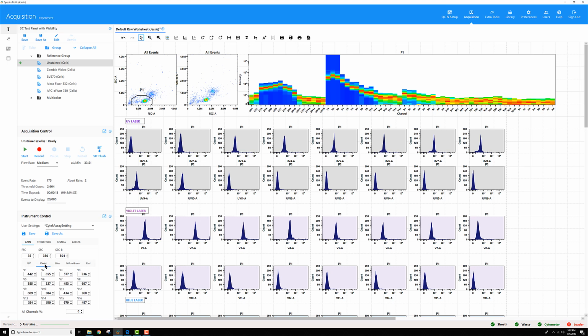So for this one, let's go to our violet dye, and I've got a couple of different options here. If I want, I can use the all channels percent gain changer, and I can bring down all of the gains proportionally across all of the channels to get everything on scale. Or, since this dye is only saturating the first 5 or so detectors, I could scale down just V1 through V5 proportionally. So if I decrease V1 by 20%, I can decrease V2 by 20%, and so on and so forth from V1 to V5. Let me show you what each of those look like. Let me put my tube on and start previewing.